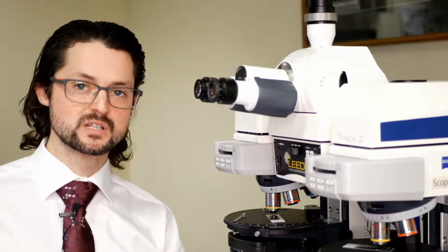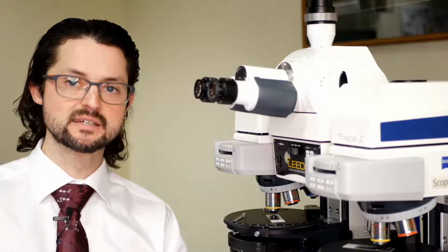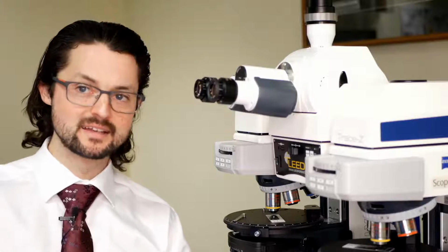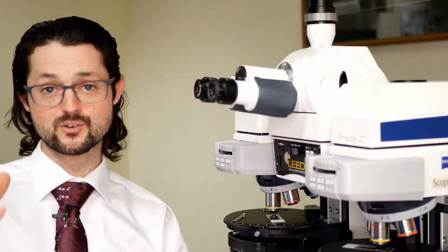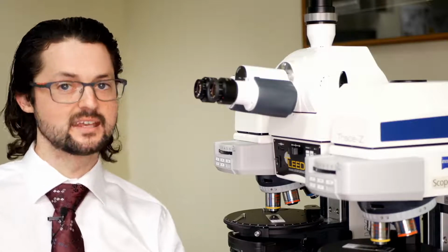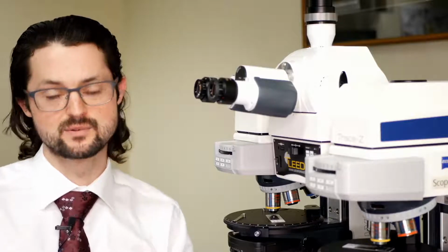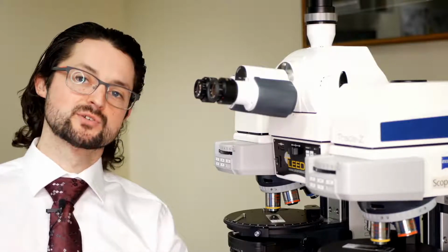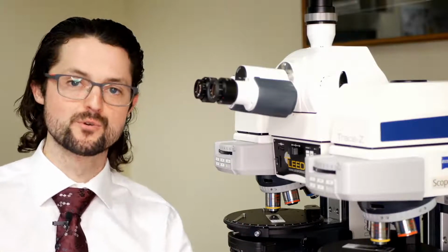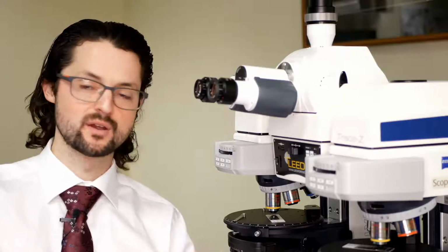What's changed, and what's really exciting, and we're going to have another video that goes all into it specifically, is LEDs. You've probably been noticing it. My ring light is LED based. A lot of indoor lighting is LED based. LEDs have come down in price and increased in performance pretty dramatically in the last decade and easily within the last 5 years. And that's also come into microscopy. Again, we have a whole other video where we talk about how we've been using LEDs for our trace comparison scope.